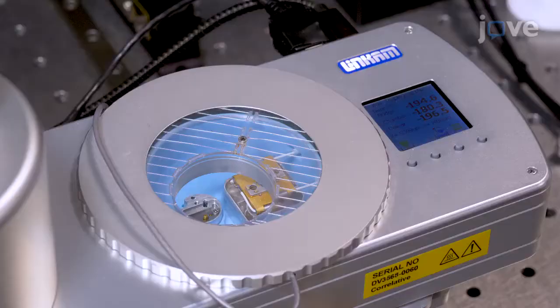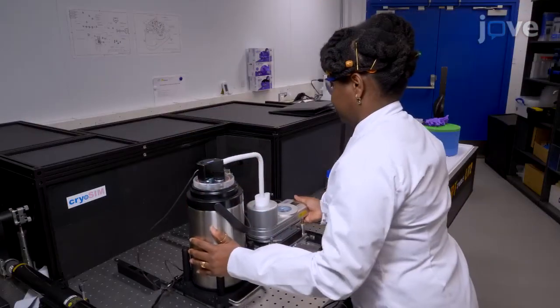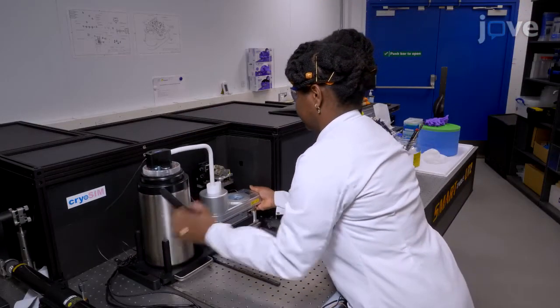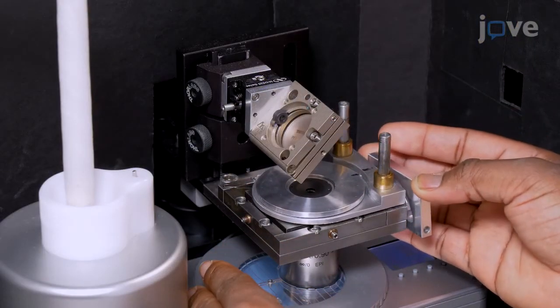This method makes super-resolution cryoimaging possible on whole biological cells to precisely identify cellular structures. It can also be used in conjunction with other modalities as part of a correlative imaging workflow. The main advantages of this technique are that super-resolution imaging can be rapidly done in cryogenic conditions using conventional fluorophores and relatively low light doses.